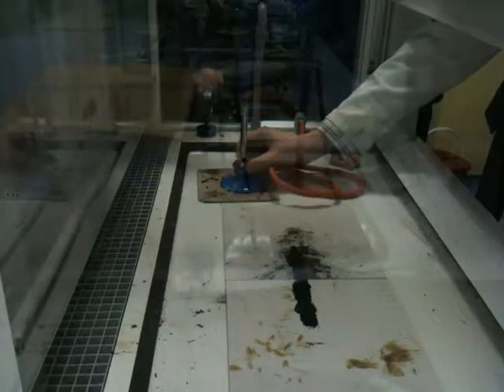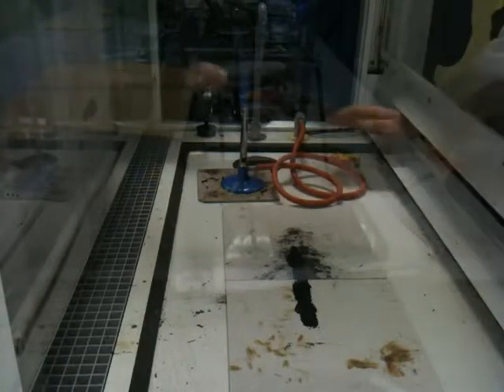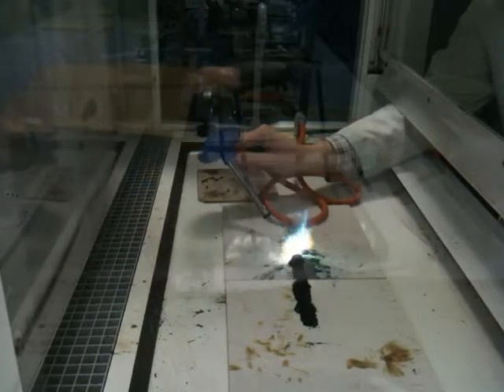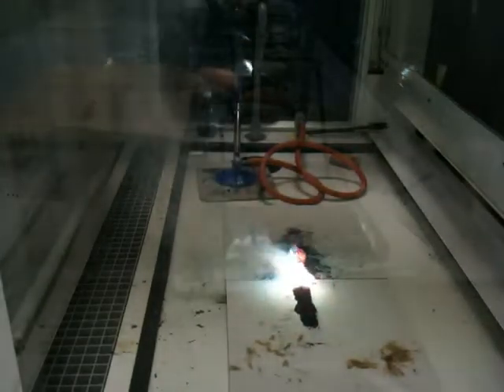Blue foam. Blue foam. Oh, my God. Whoa. Blue. That's pretty awesome. That's better. Is that what you were hoping for the first time we did it? No, it's good.